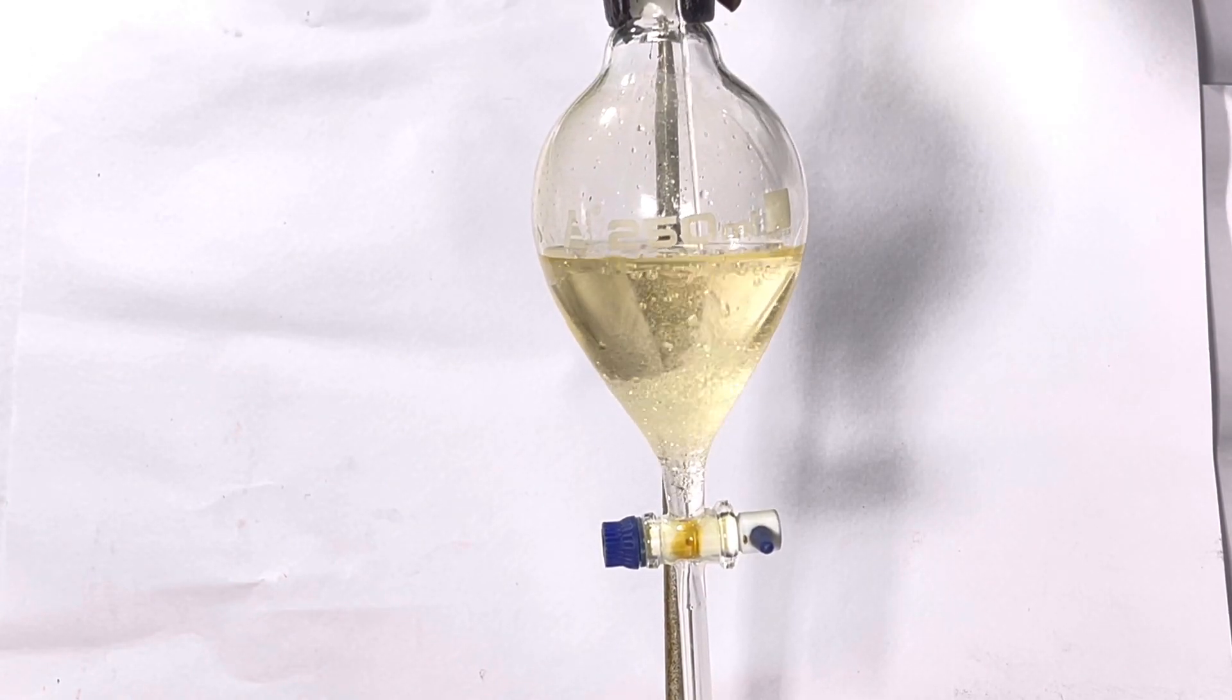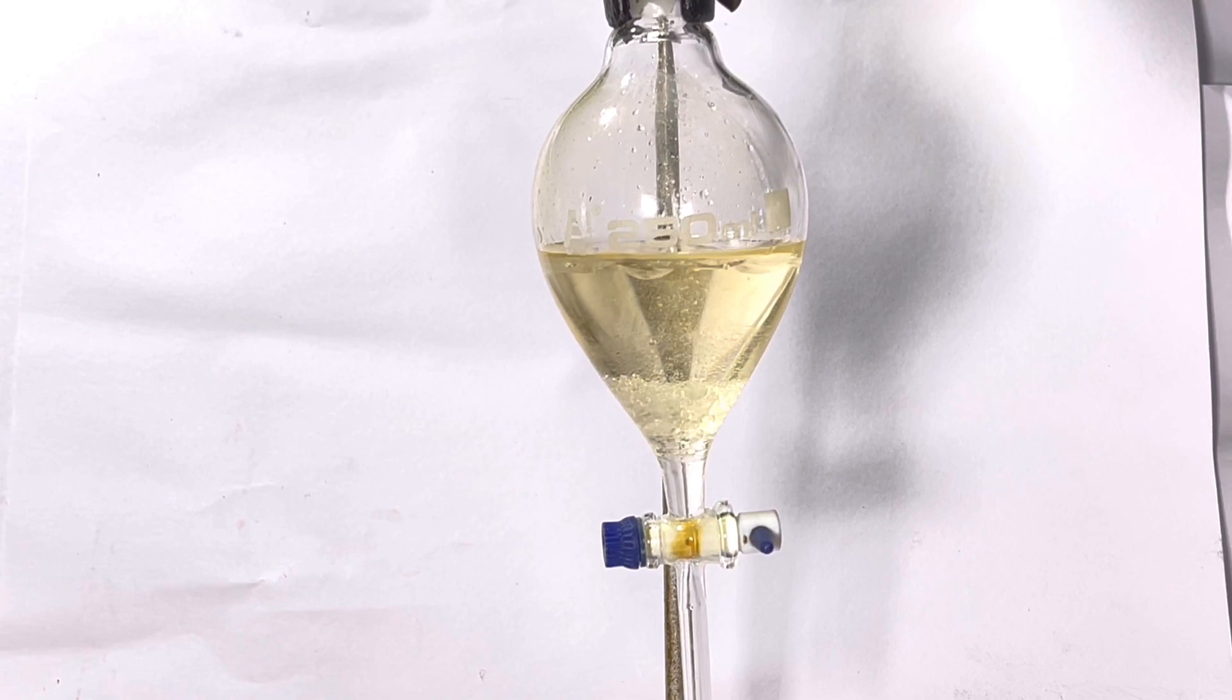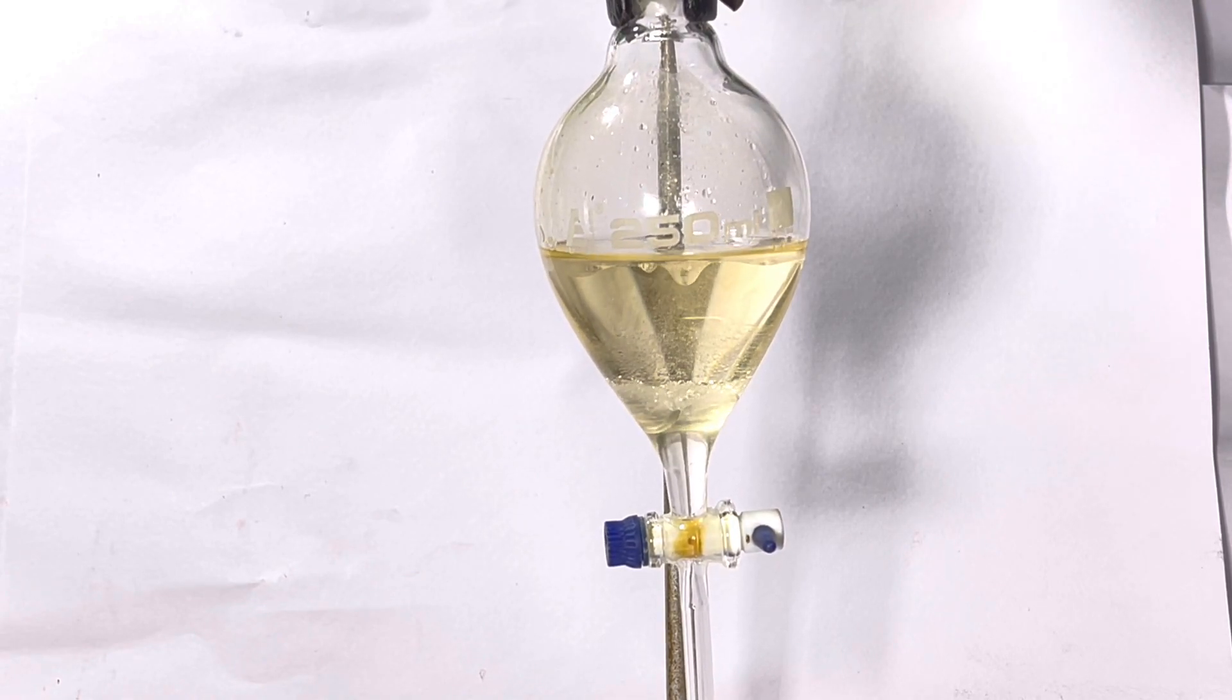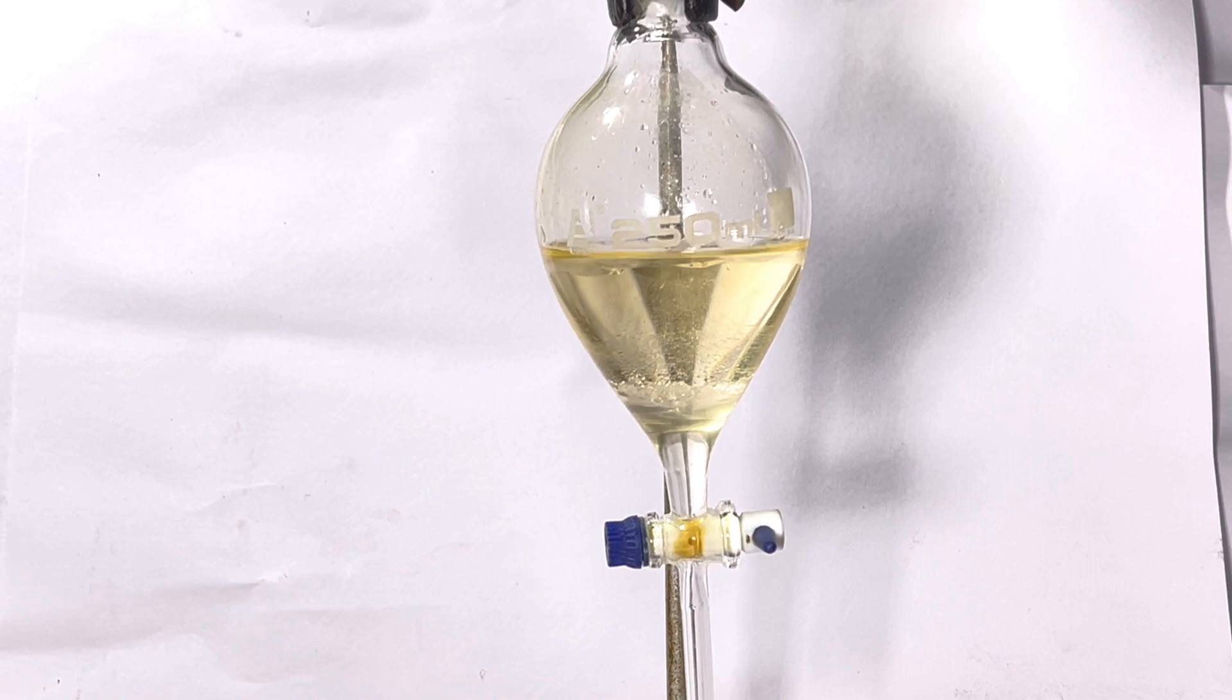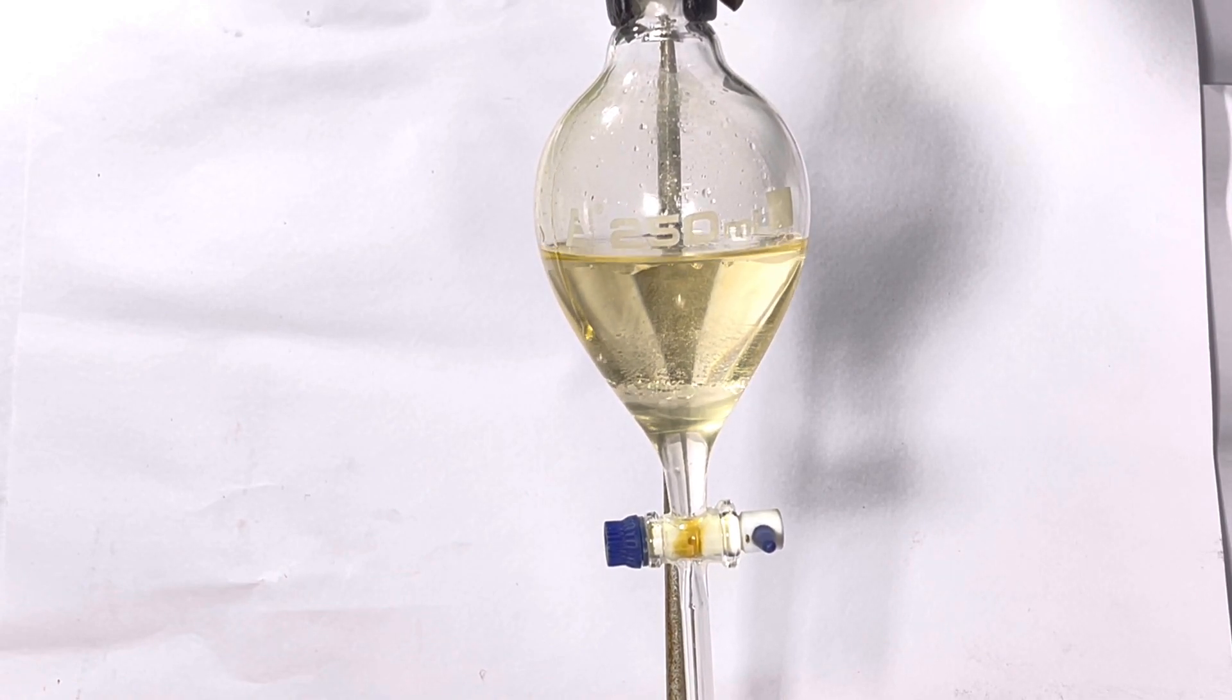The clip is not shown here but the organic layer was transferred to a separatory funnel and washed successively with approximately 30ml of water, 30ml of 5% sodium bicarbonate solution, and another 30ml of water.